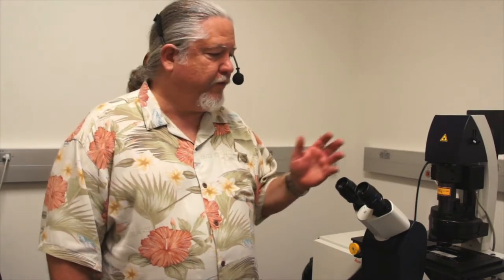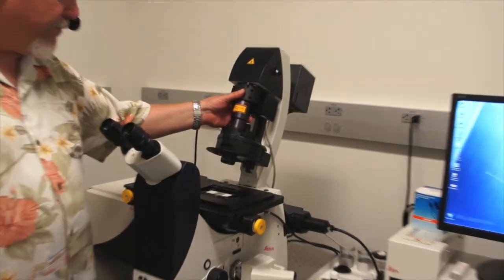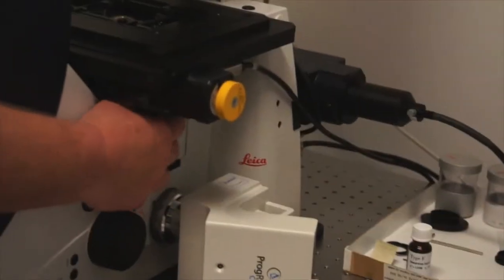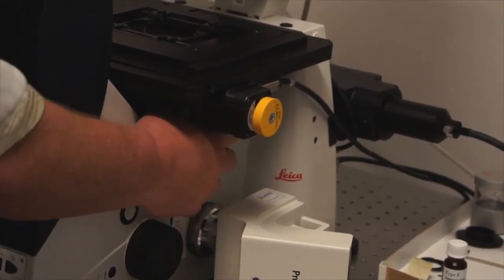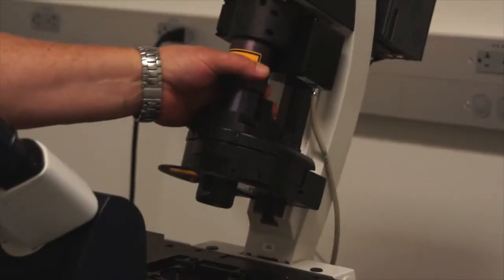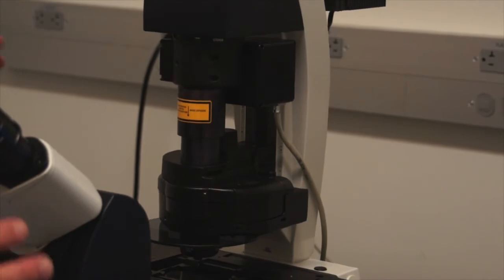Before we end our current session, it's important to follow proper shutdown procedures for using the light microscope. The first thing we do is we rotate our condenser out of the way. We take our specimen off the stage, set it aside. We dial our nose piece all the way down past the 10 objective to the blank spot and put the condenser back in place. Now the microscope is ready to be powered down.